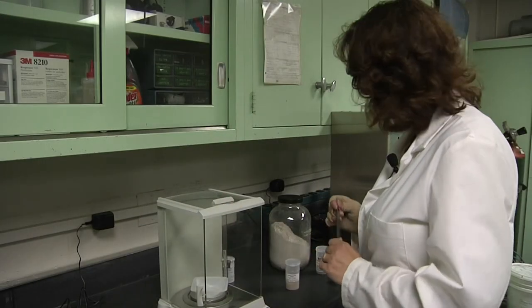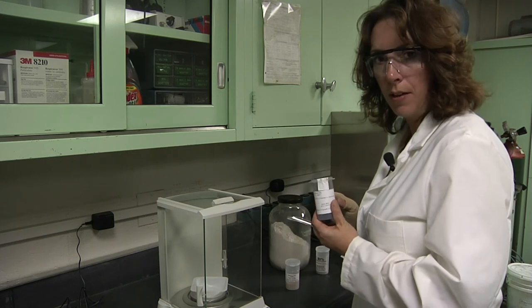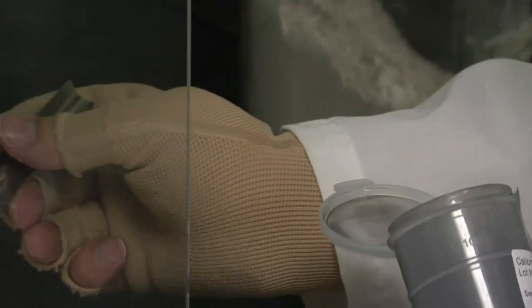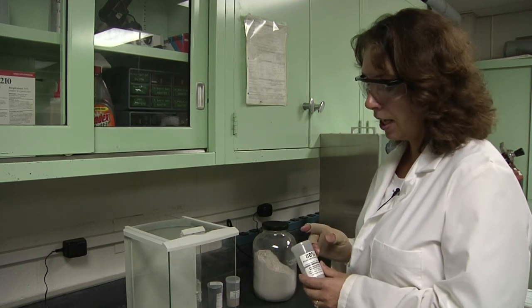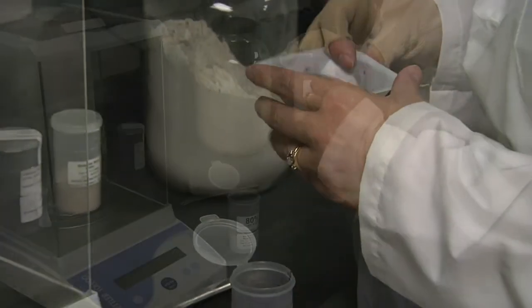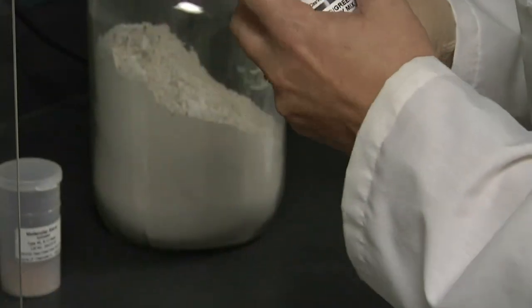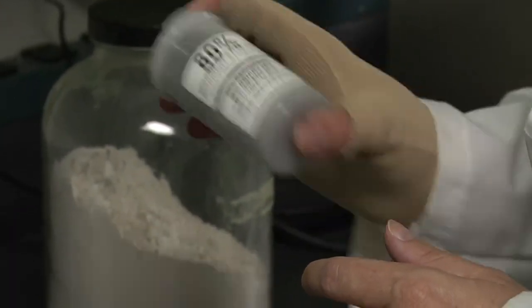Next, keeping your utensils clean, weigh out 10 grams of the PPC. When you have your 10 grams of PPC, add it to the 40 grams of rock dust that you have already placed in your 80% calibration container. You can add some molecular sieves to ensure your 80% calibration sample is dry. Thoroughly mix the PPC and the rock dust.